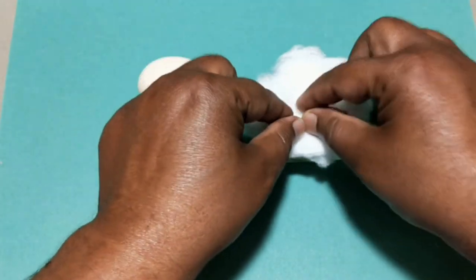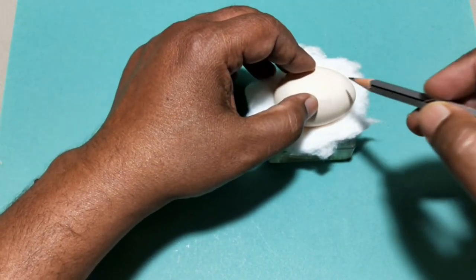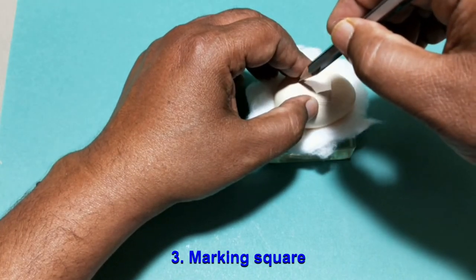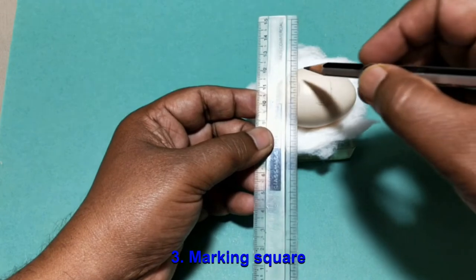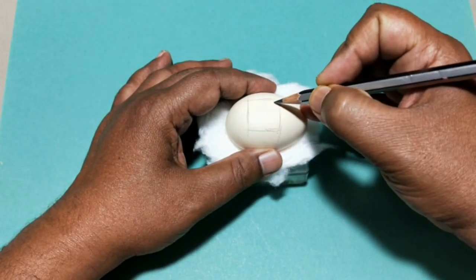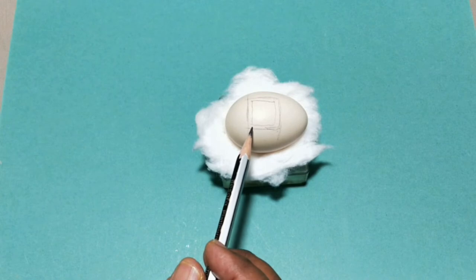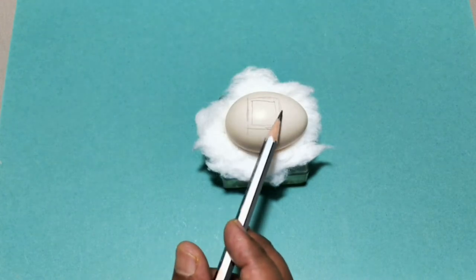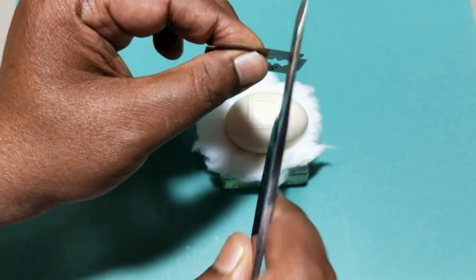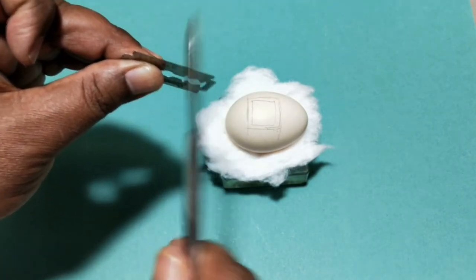Keep a cotton cushion on an embryo cup and place the egg on it. Place a cover glass at the center of the egg and mark its border using a pencil. Mark another inner square with 3mm less than the first one. This 3mm gap is to build the wax wall or platform to mount the cover glass. Take a blade and make the edge rough or saw-like by hitting with a spatula, so that the blade cuts the eggshell easily.